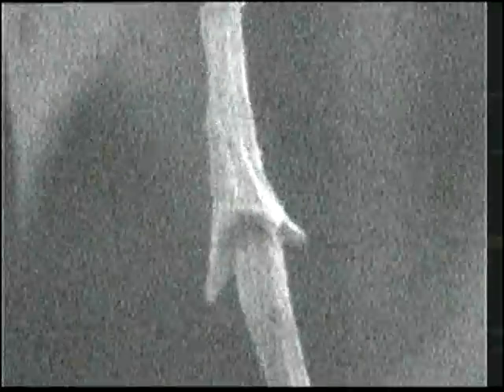And let's see. Here's some more of this. That's a nice example of it. Get a different view of it. Oh, that's cool. That's cool. And let's see, I think there's some other structure. Well, here we can see sharper ones. Maybe those are ones that were just beginning to expand out by splitting off or something like that. So that seems to be the predominant structure that's on budgie feathers.